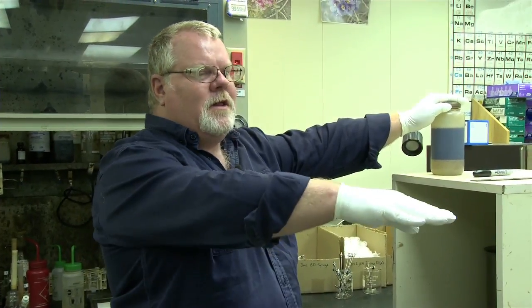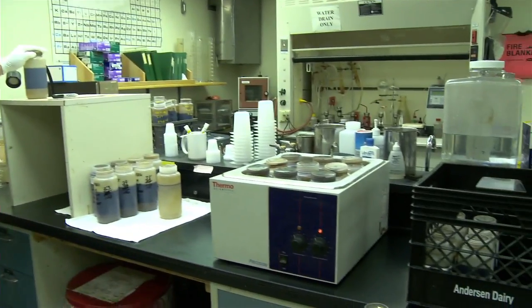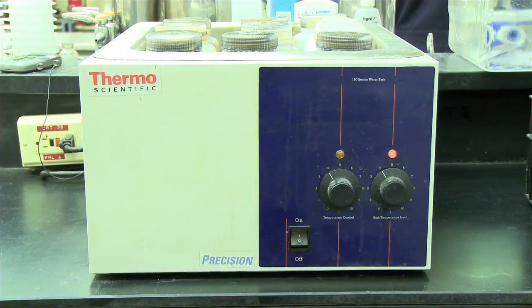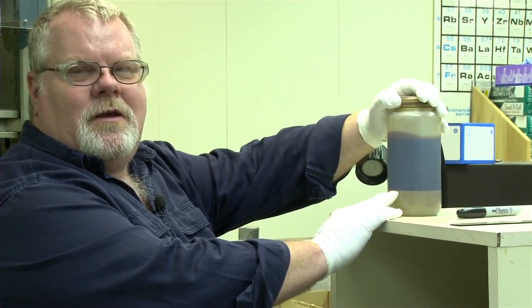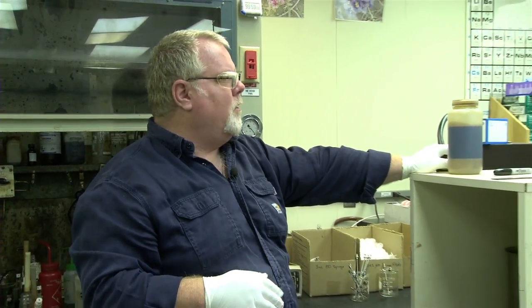Some samples need more, some samples need less. They go through a water bath at 140 degrees until they're properly separated. And then what we're looking for is a good clean break in the sample. When they come in, usually right out of the well, there's just not that good clean break, so we make some effort to separate as much of the free water as we can from the crude oil.